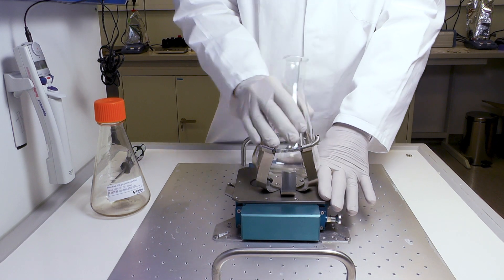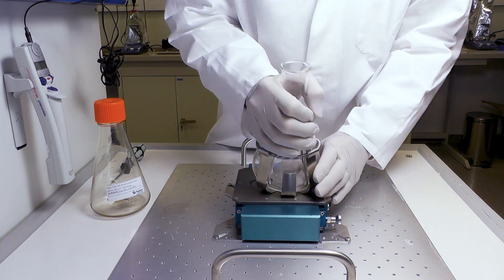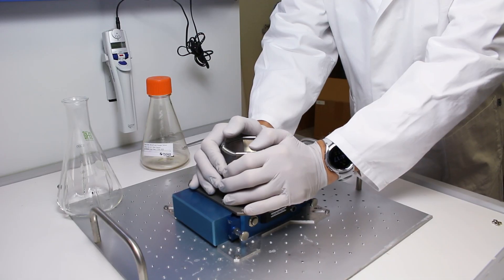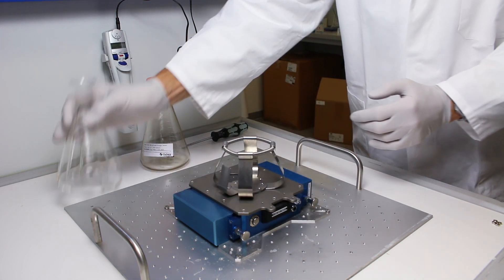A glass sensor flask has a metal knob attached to its side. This knob must snap into the arm on the clamp side to hold the flask in position above the reader optics.